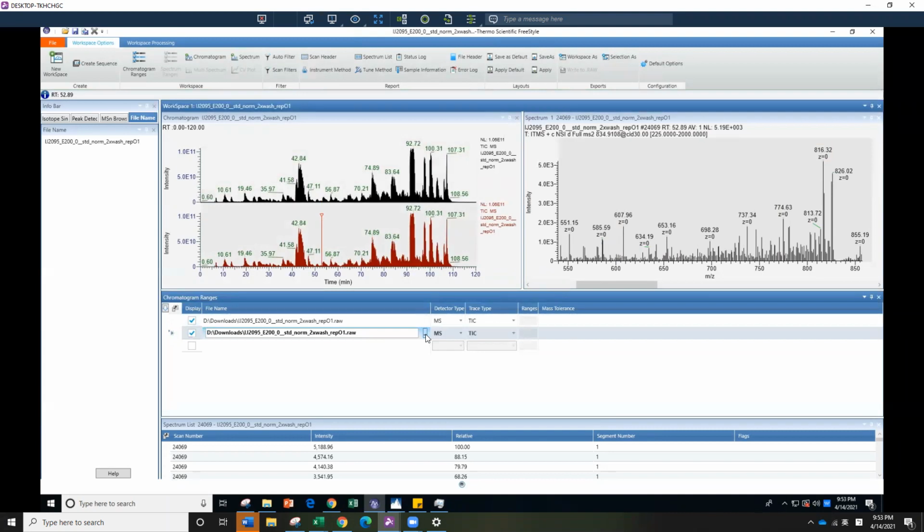Okay, but the other thing we're going to do a lot in our lab is compare the retention time between samples. No matter the turnover rate, if you want your data to go into deuterator, we have to make sure the retention time shift is not huge. And on our data, sometimes when you're running your samples on different analytical columns, it can cause different elution times between runs. So if you're going to analyze them together, make sure they're run back to back and randomized.